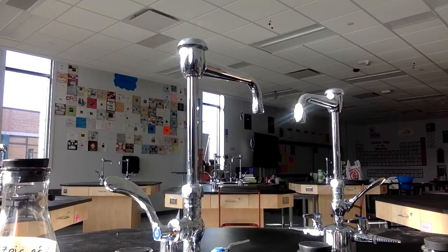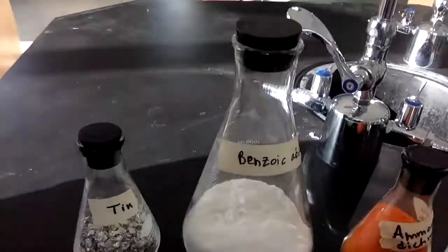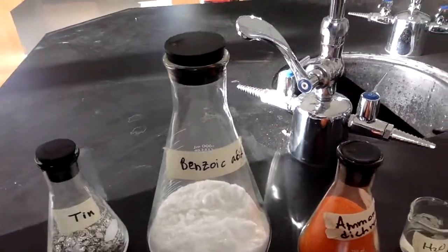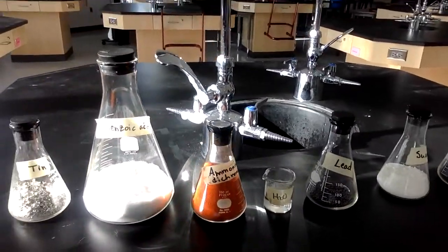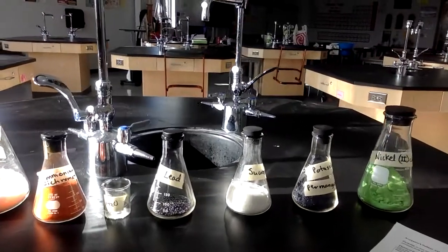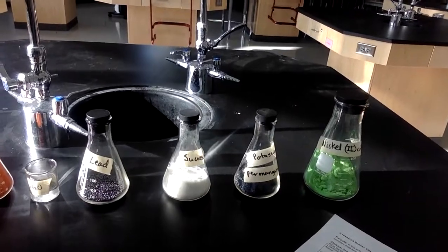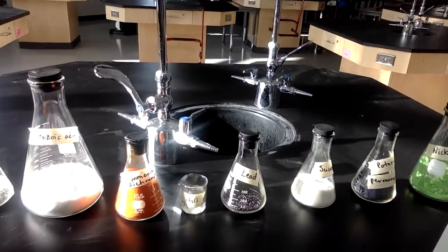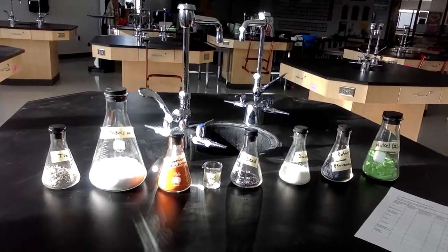All right. So then I'm going to give you a chance to look at all of these set up on their own. So I can show you, let me, there we go. Showing you the different sizes of the containers next to each other. We've got the sun shining on them a little bit, but now these are all a 1 mole sample of different chemicals. You can pause the video at any time if you want to see them in comparison. Here now you can see all 8 of them next to each other.